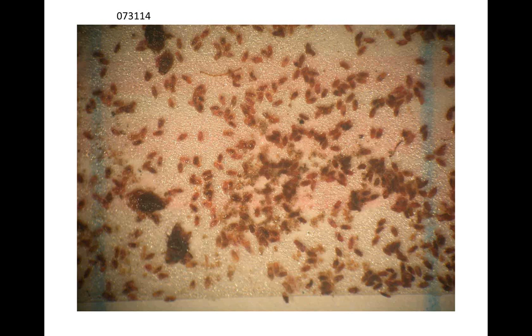But what I want to ask John, did those larger ones, were they always just a distinct minority, or did you have some weeks where earlier in the year, back in the April time frame, essentially all I was seeing was the larger ones, and then we move over into July, and I started seeing the smaller ones as well. Now, isn't this picture from a July sample? You got that 0731 number up at the top. Right, that's the 731, yeah, the end of July. So you saw a lot more of these early in the season.